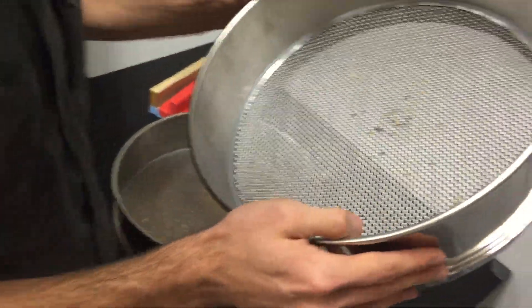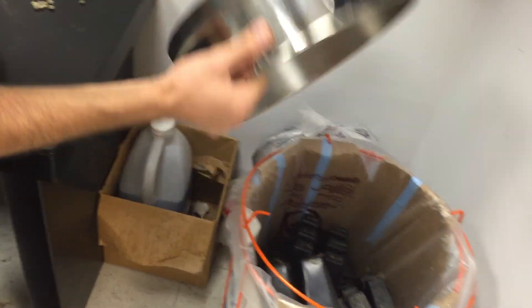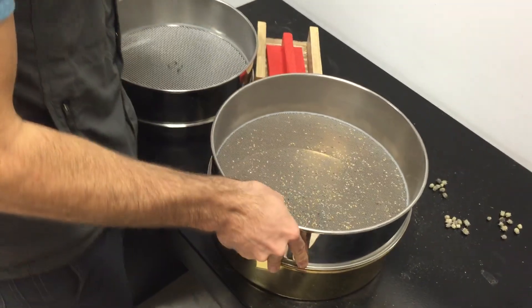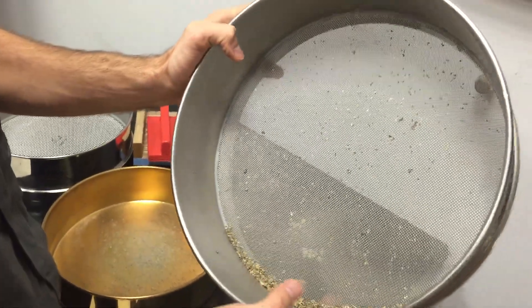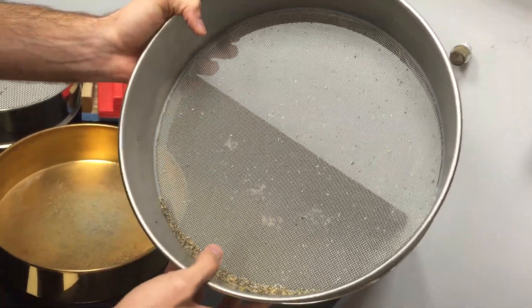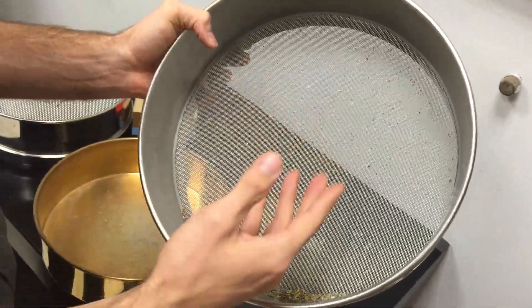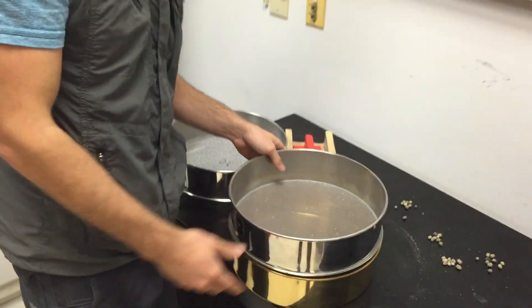Just double check if there's any seeds up here — you want to make sure to collect them. Otherwise, this debris gets tossed. And then eventually, once we've gone through all the pods, we'll have the seeds here. The final step will be to try to get all the pod debris out of the way and only end up with the seeds. And that's the general protocol. Thank you.